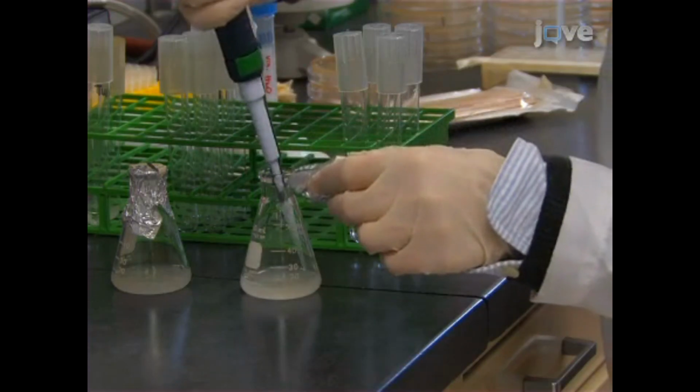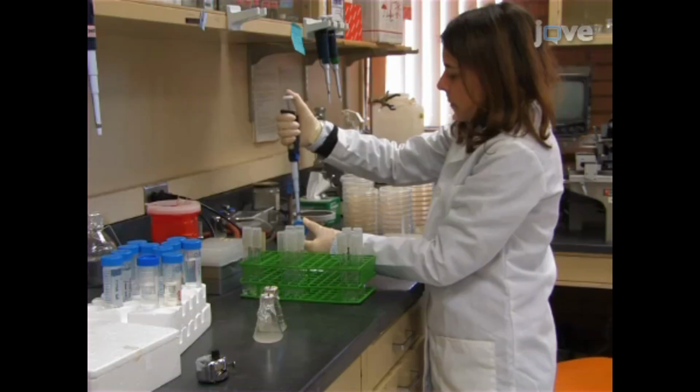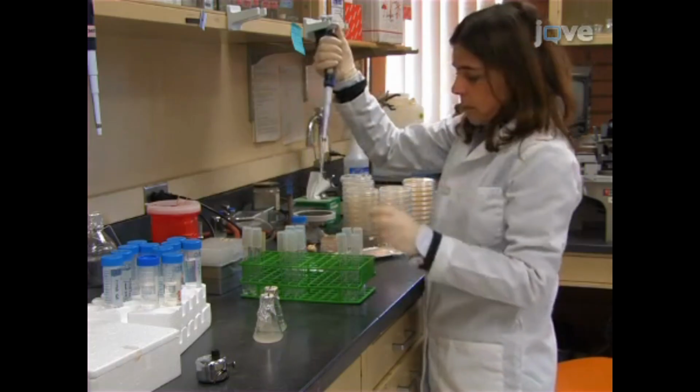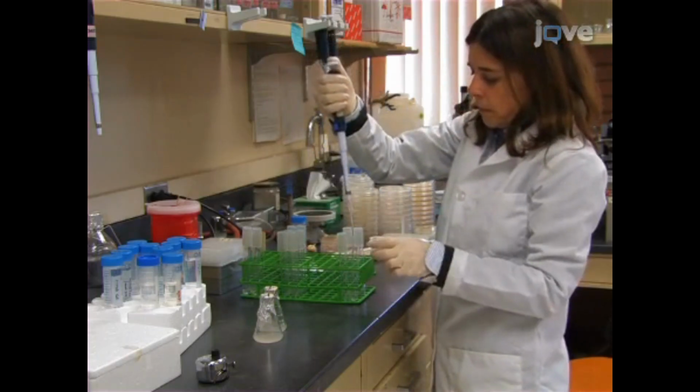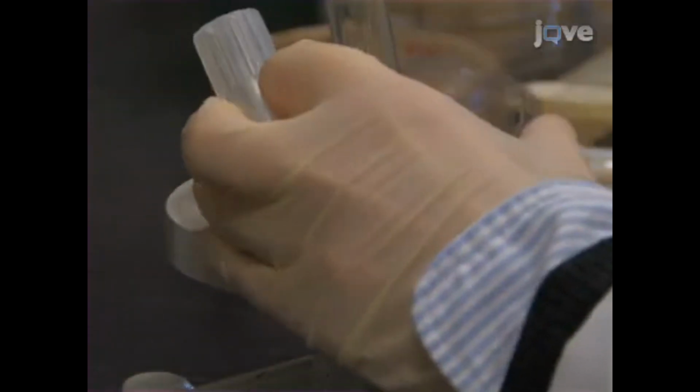Continue removing aliquots from the aging culture in subsequent days for plating, adjusting the dilution factors accordingly to ensure about 20 to 100 colonies in the CFU assay. Sampling is stopped when the viability of the culture has decreased below 1%, typically between days 11 and 13.